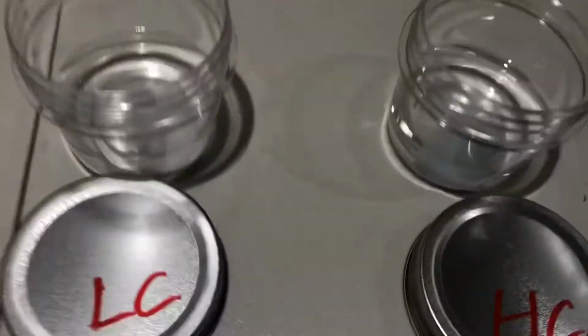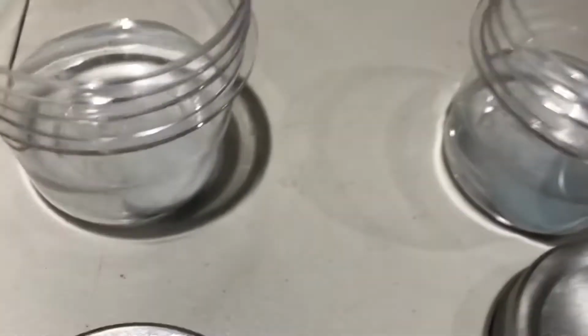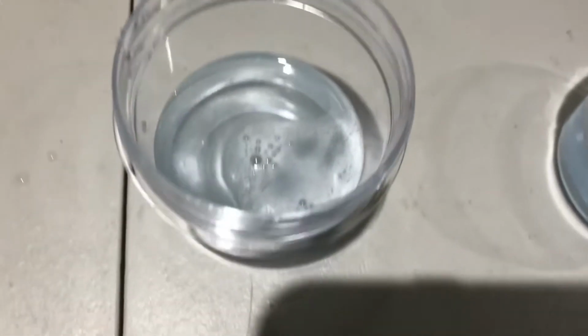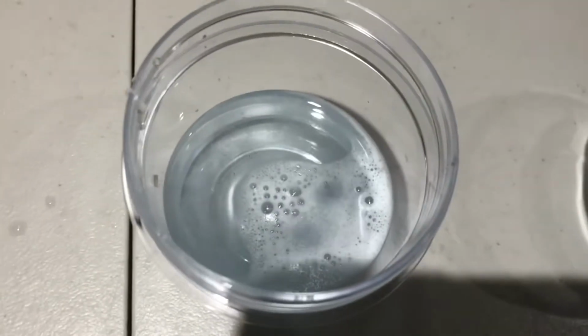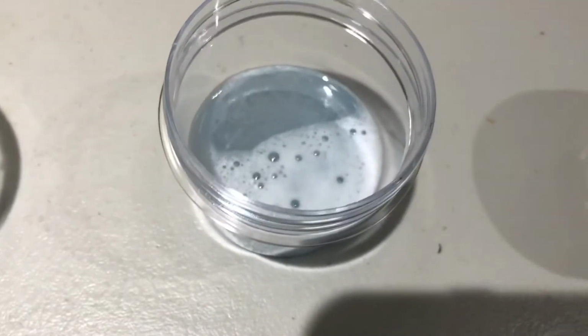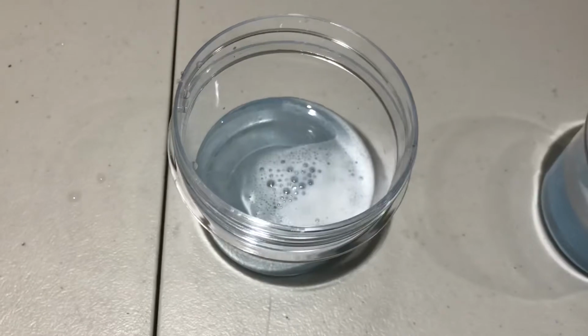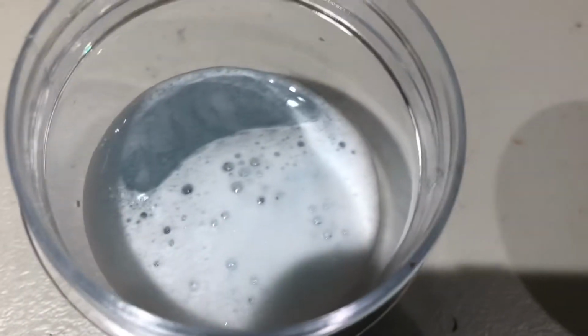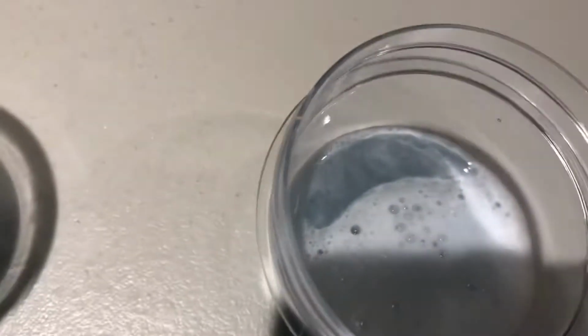Okay, alrighty, we drop those guys in. Okay, let's see what happens. We're looking at low temperature over here, and the higher temperature over here. Oh goodness, concentration. Okay, so once again, guys, this is a low concentration versus high concentration. This is low concentration. This is higher concentration. All right.